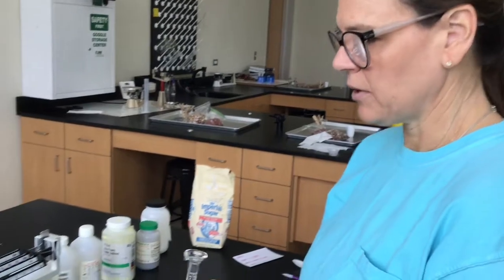Now we're going to move to the liquids, and I'm going to find the mass of the container. For liquids, we are using a graduated cylinder because we're going to measure 10 mils of each liquid, and then we'll find the mass first, then add the liquid, the 10 mils, and find it together. I'll record it on the card for you like I did last time, so that you'll have the data. All right, here we go.